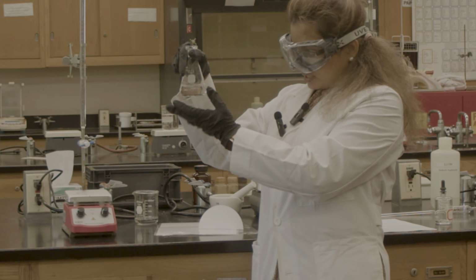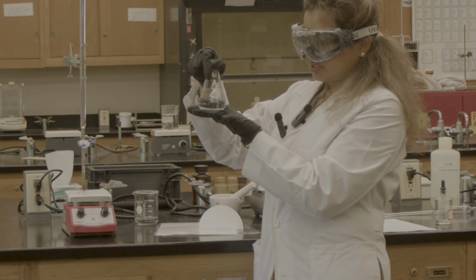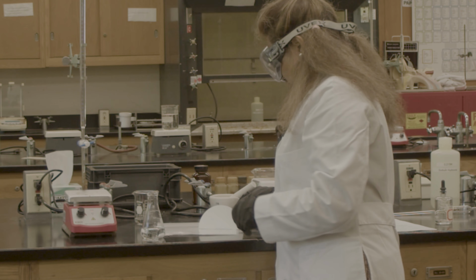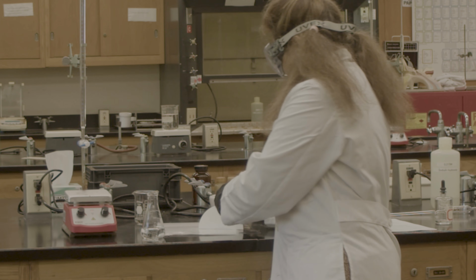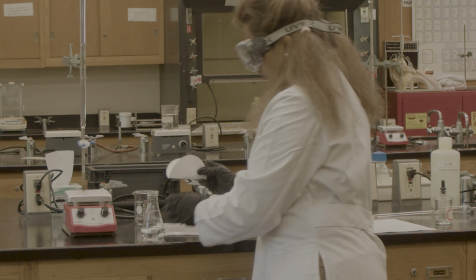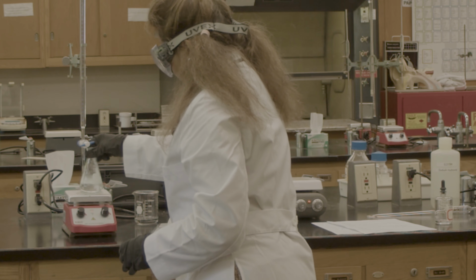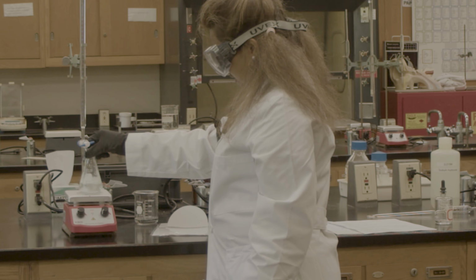You can see the white thing, which is actually the magnet, which helps me get the stirring. The tablet, I crushed it because it takes a little bit longer to dissolve. I'm pouring it here. All right, just make it dissolve with my stirring.